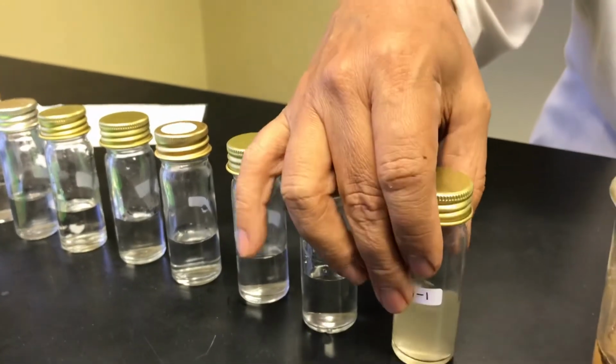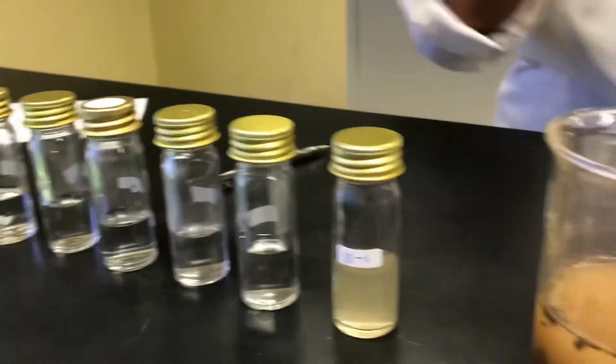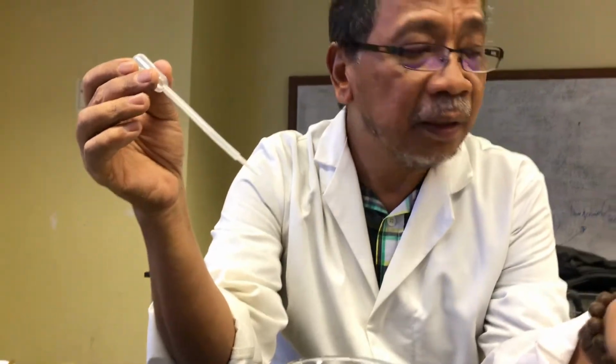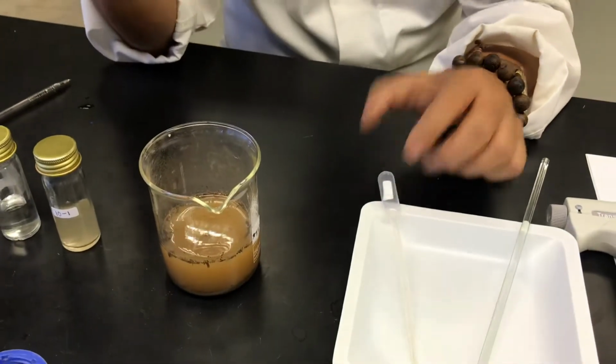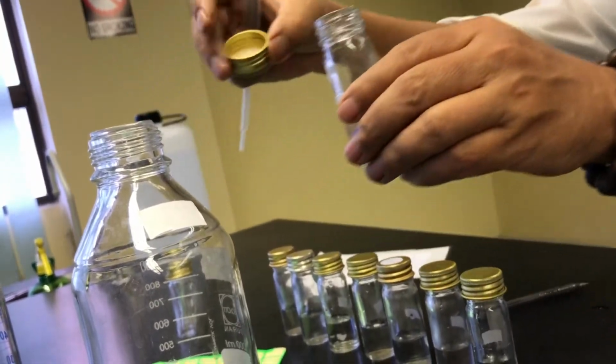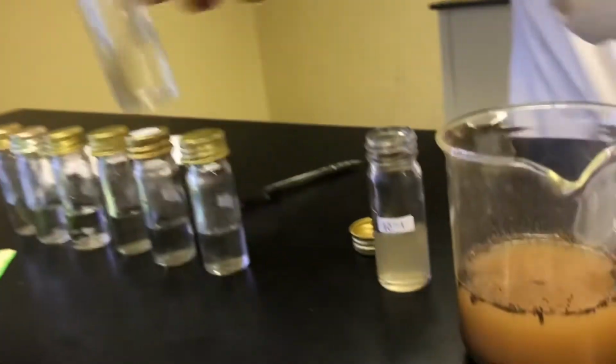Okay, and then if you use a micropipette, you get the tips. Let's say if you use this one, don't use the same one. So you use another dropper. Yeah, this is a dropper. You open again, you swirl. Imagine that you're in the laminar flow, and then you open this.